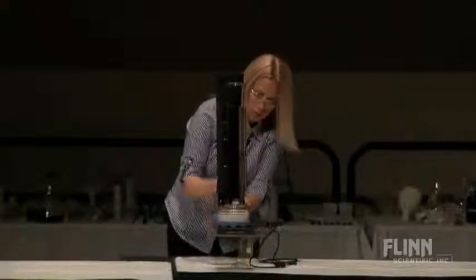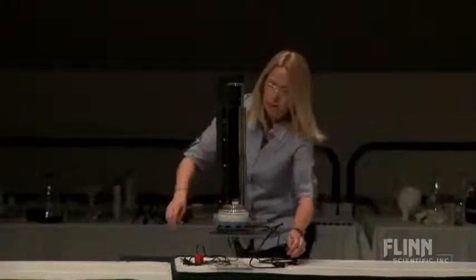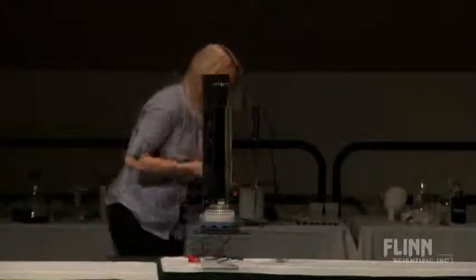I've got a magnetic stirrer here and a little blacklight. Let's move this glowing goodness over here. I'll plug both of these guys in. I hope this is lined up so all you guys can see this well.